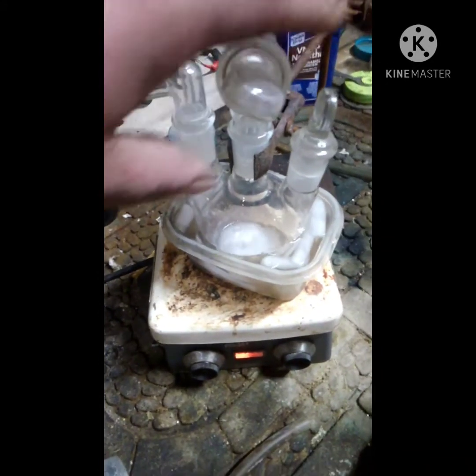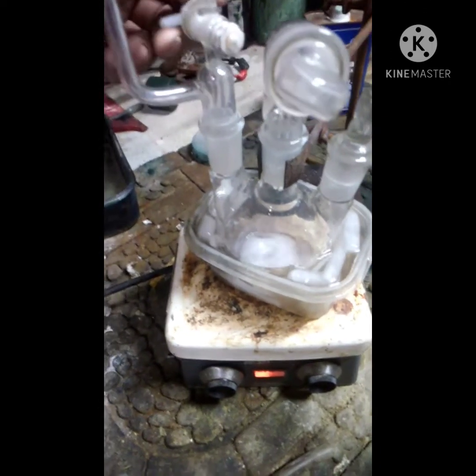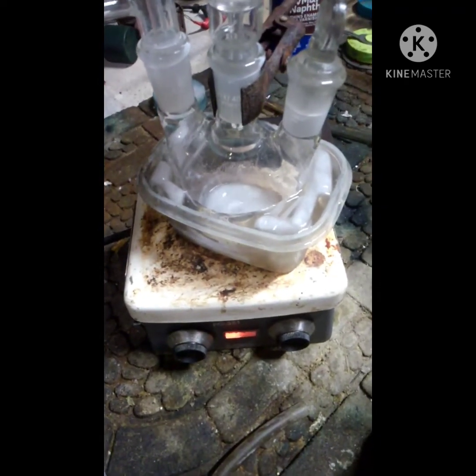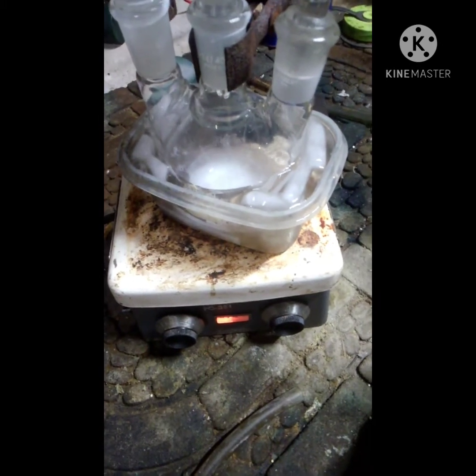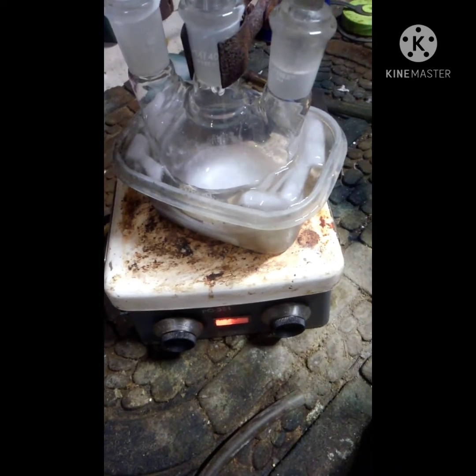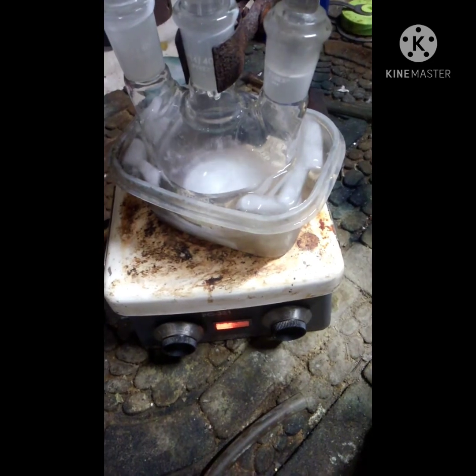I just have this here as a stopper because it's fused to that — yay for fused glass. It was going way too fast at first, but there we go, got the drop rate under control.